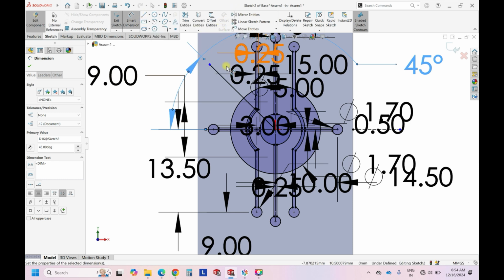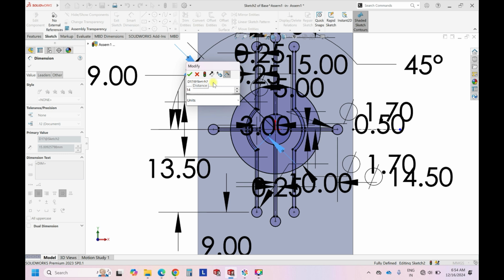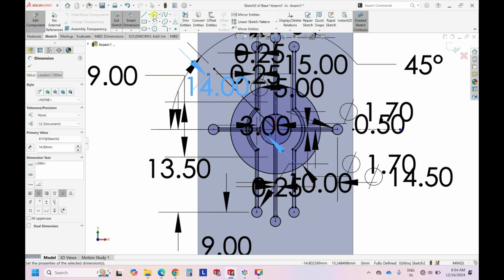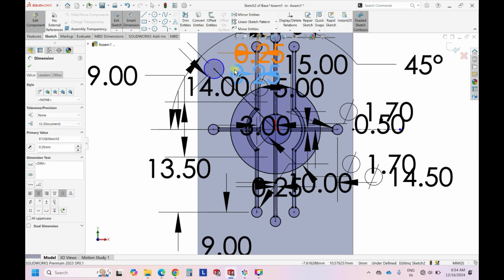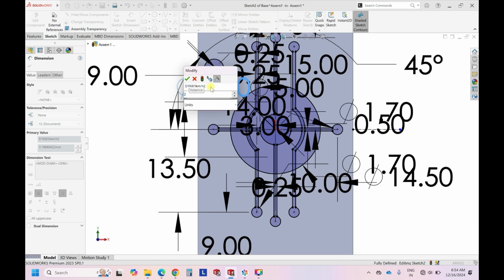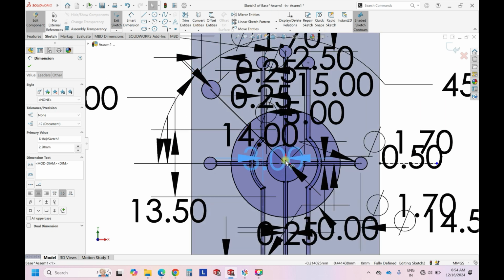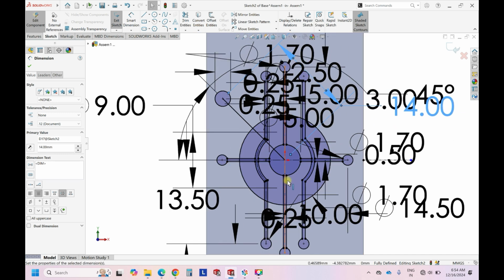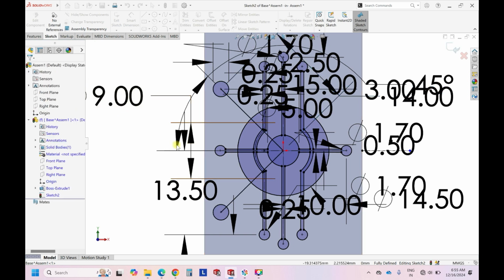And similarly, we can choose the length of this. We can keep it as 14 mm. Okay, and we can have it as a bigger outlet. So it was 1.75, so I'm just keeping it as 2.5. Now similarly we can just do the mirror of this and this about the center, right?